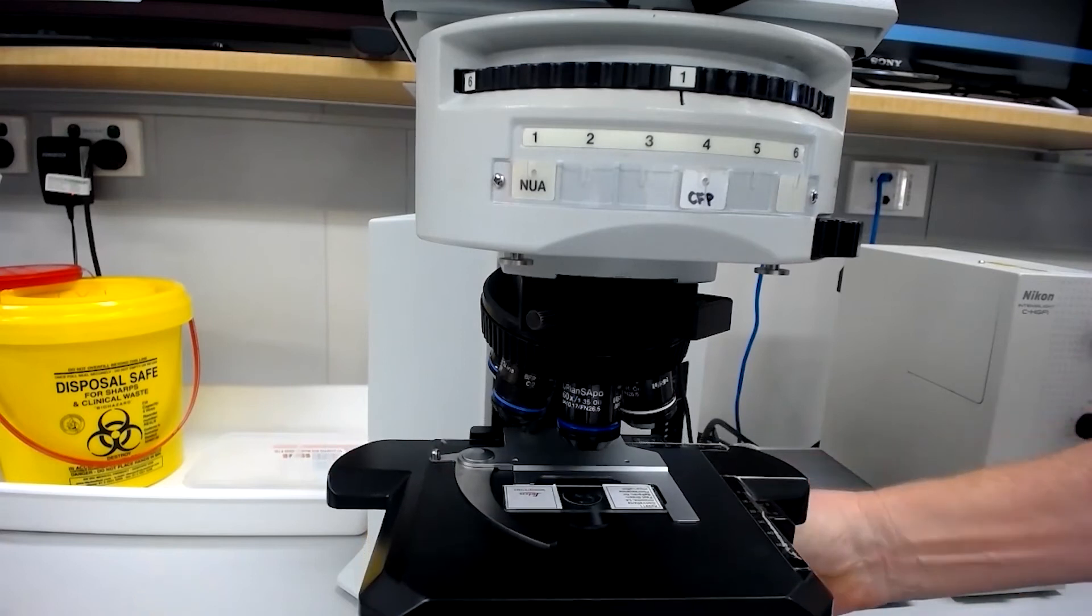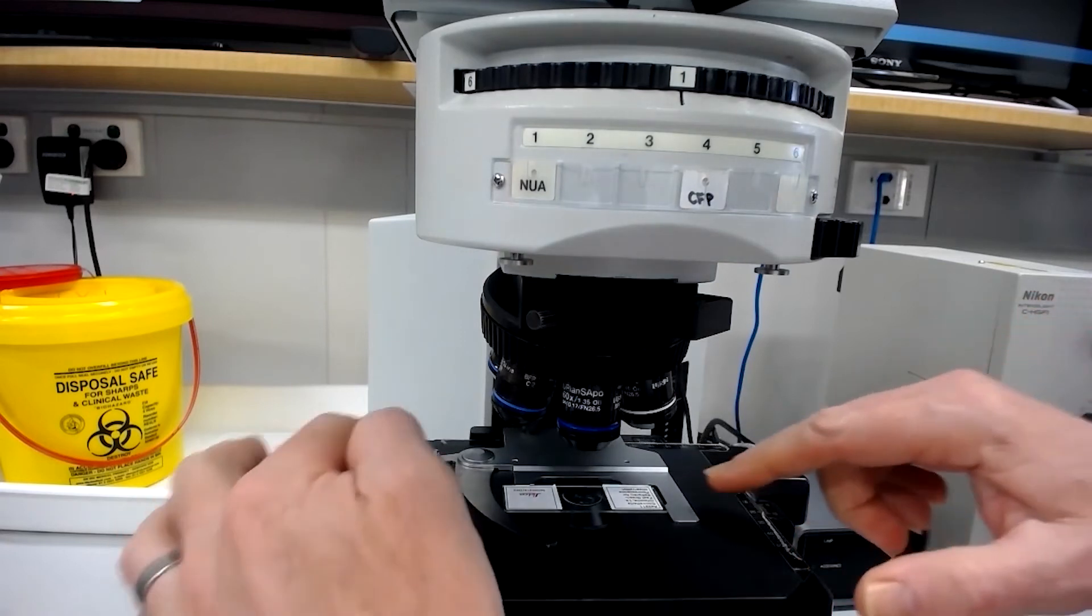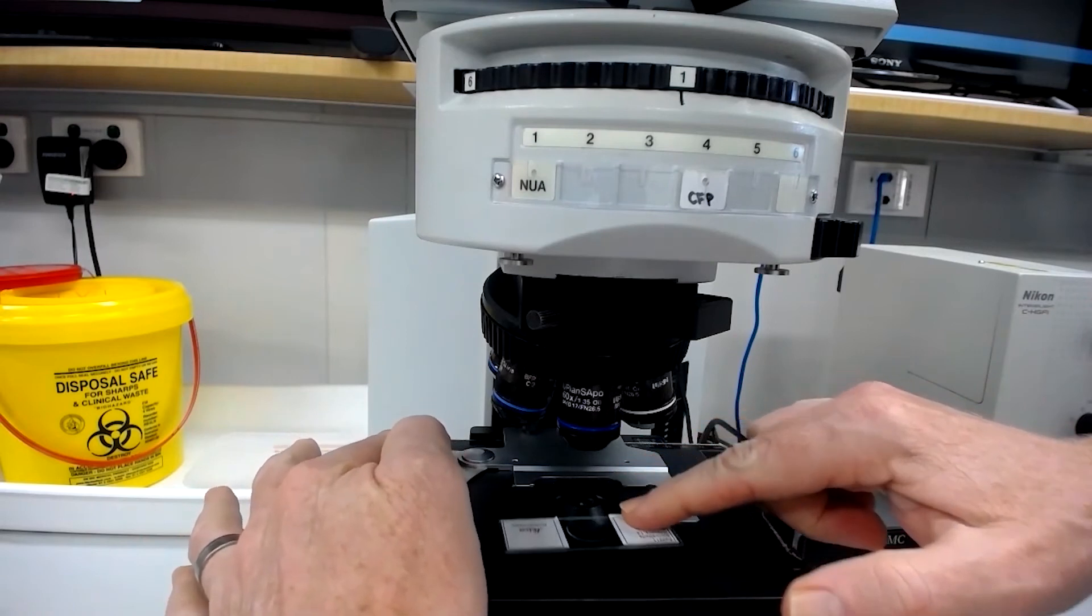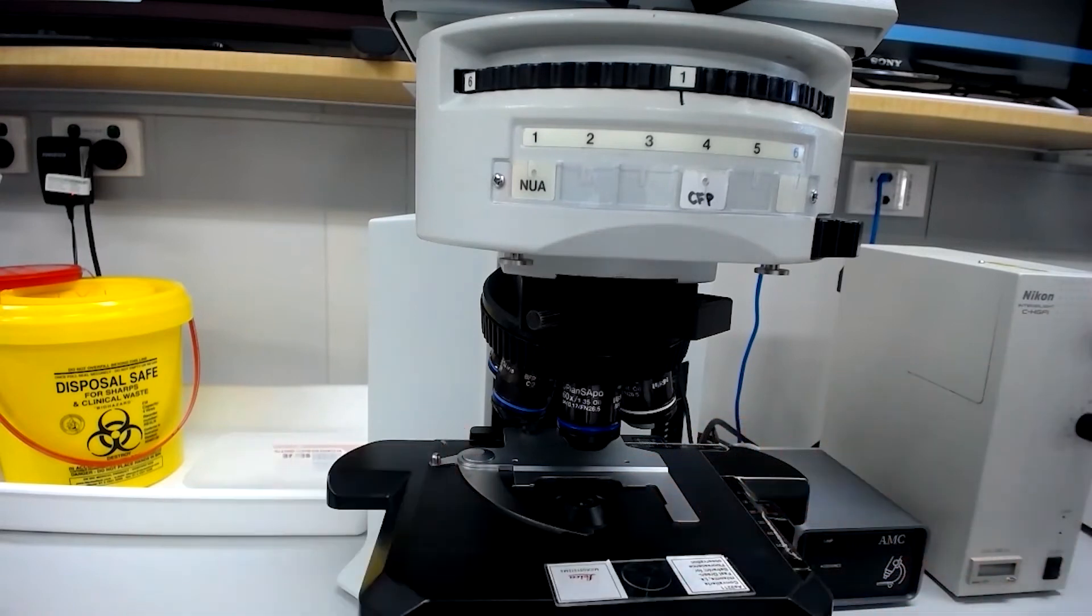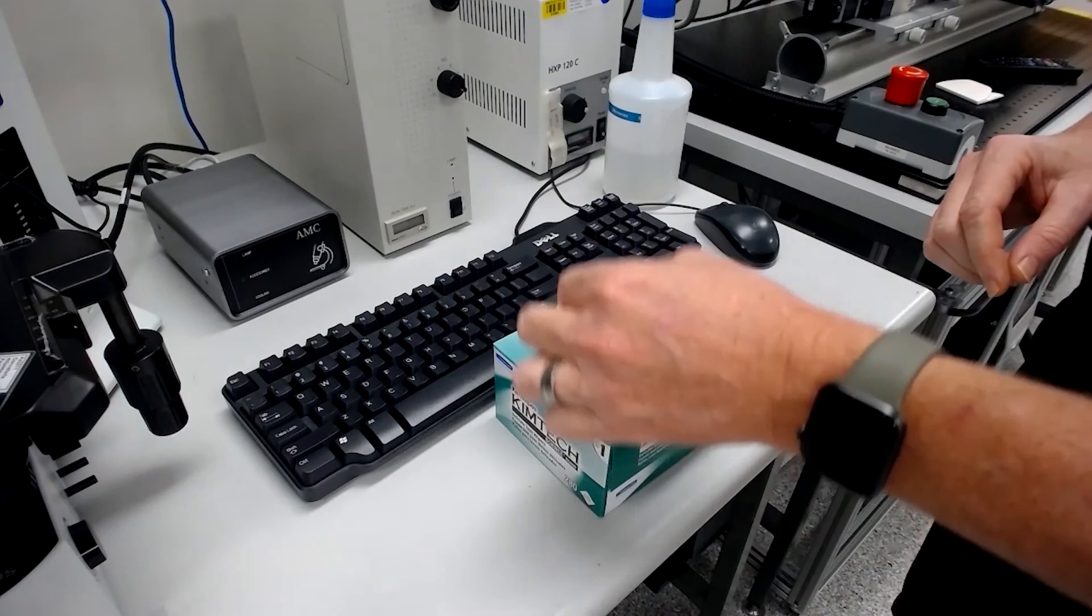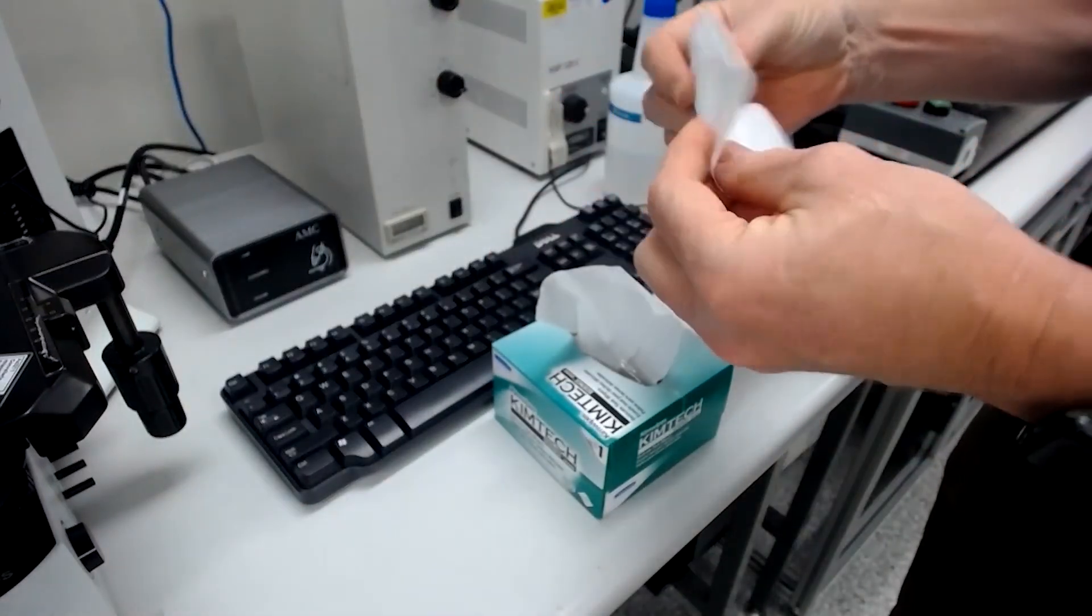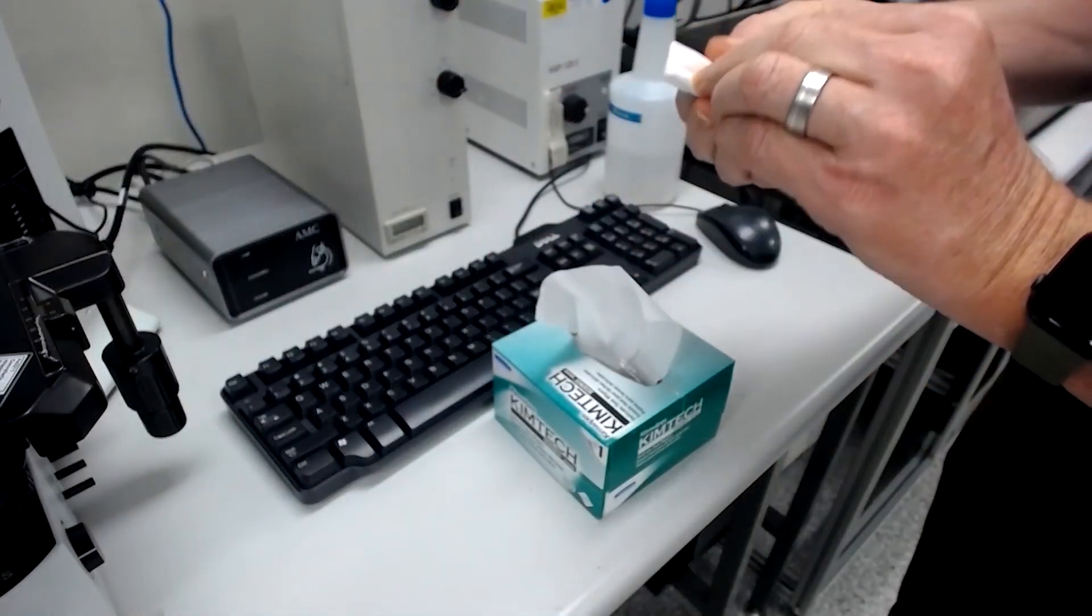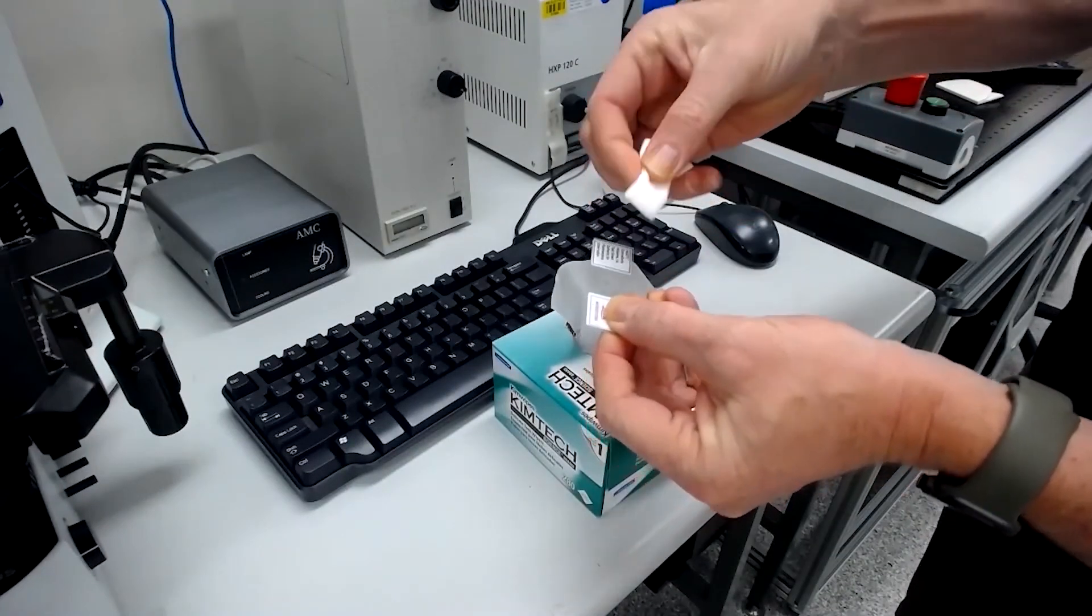When you have finished imaging, withdraw the objective from the slide or specimen by using the Z position knob. Remove the slide or specimen and clean the cover slip with a kimwipe and 80% ethanol.